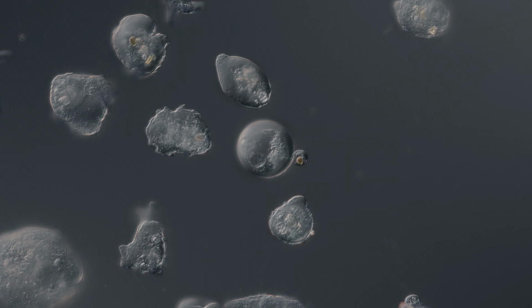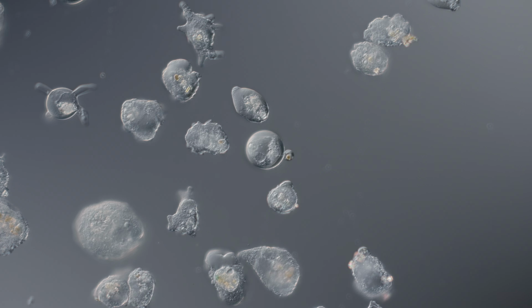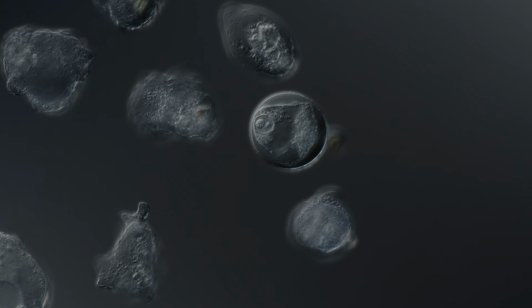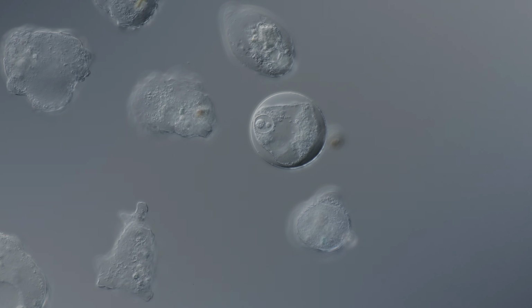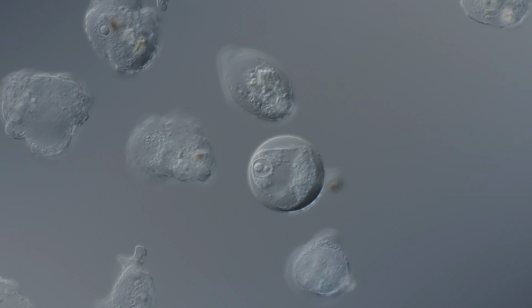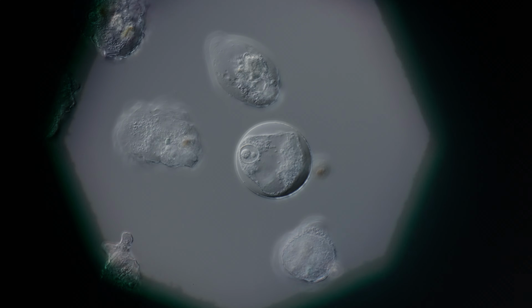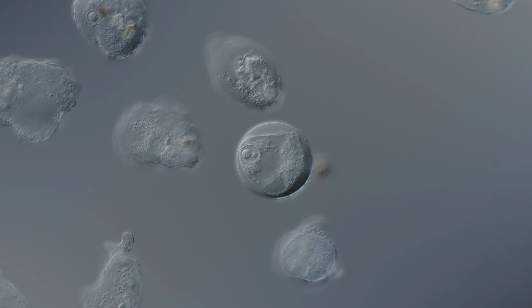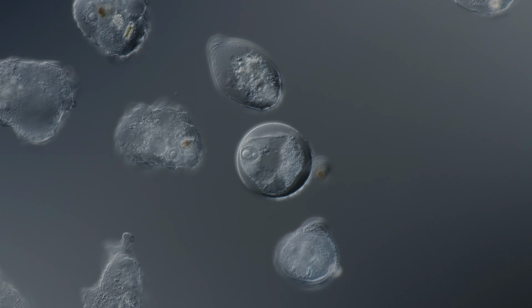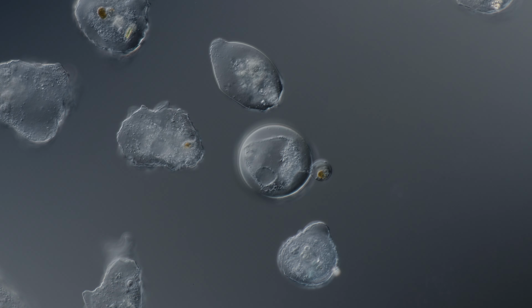Let's switch to the 40 for a sec. Yeah, here's a nice view. I'll adjust it as well.